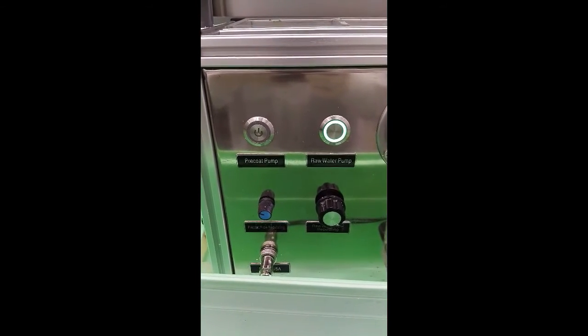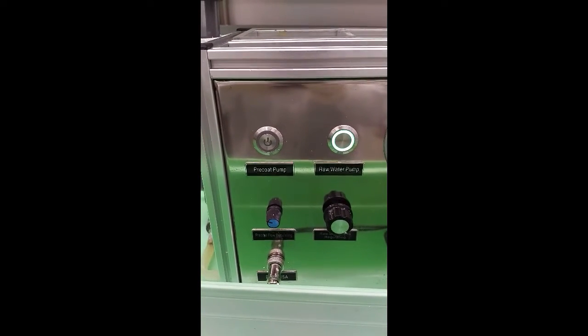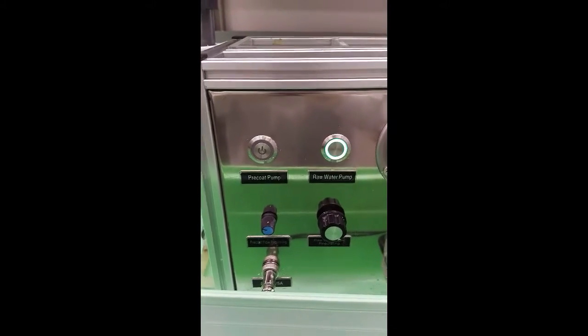That's feeding the water right now, and then we also have a pump that feeds the powder that goes on for the replaceable skin layer.